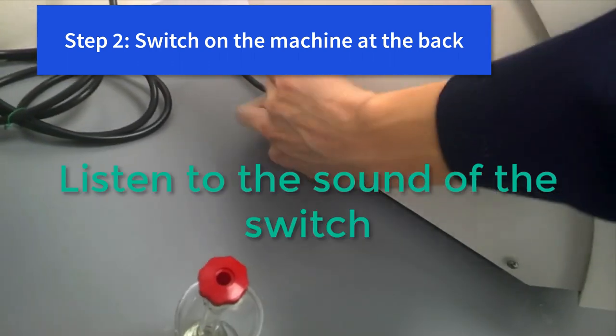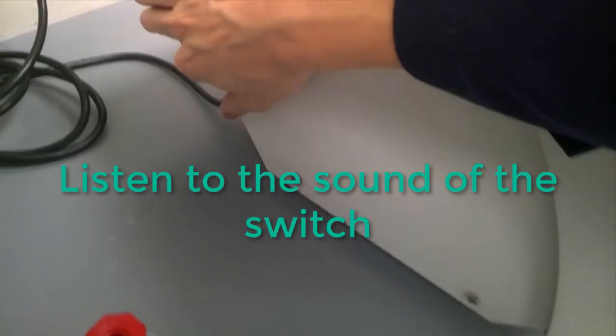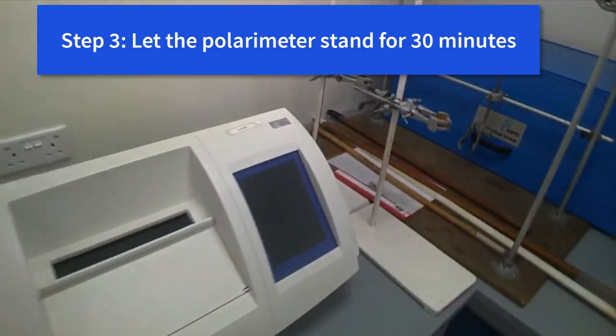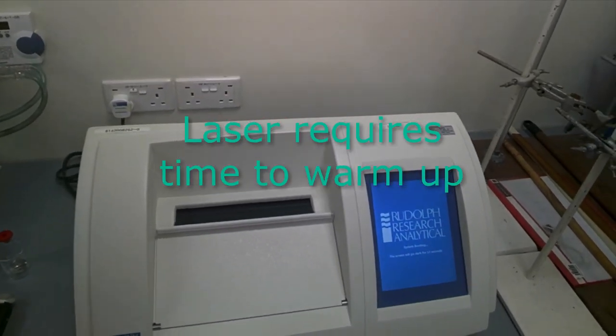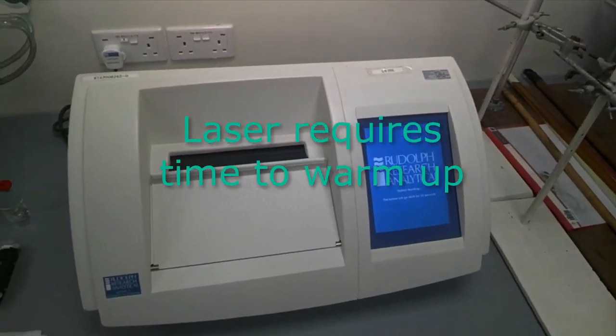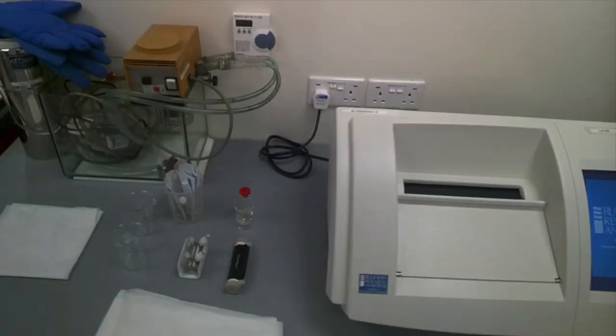Now this polarimeter, you have to let it stand for about half an hour to warm up. Why is that so? Because we are using laser and the laser lamp needs to warm up first. If not, you won't get a stable reading.